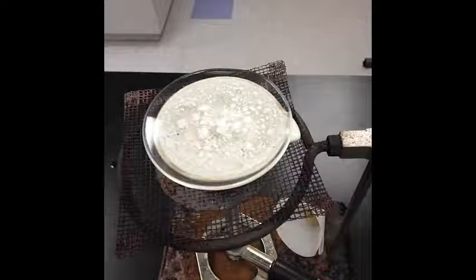Now, at this point, once it's dry and we've let it cool, you can mass the watch glass and evaporating dish, and from that mass find the mass of the salt that you've recovered. We'll also need to weigh or determine the mass of the paper with the sand, and that has to be completely dried, so we'll wait until that's completely dried.